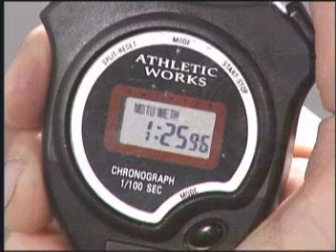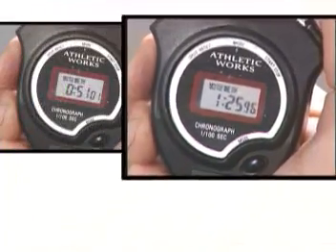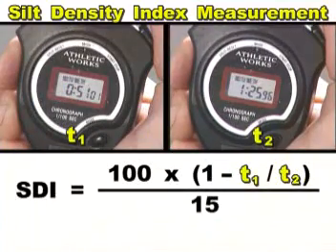The starting and ending times are entered into an equation and an SDI value is obtained.